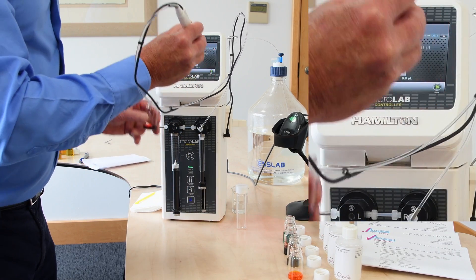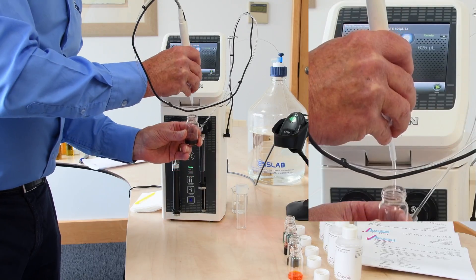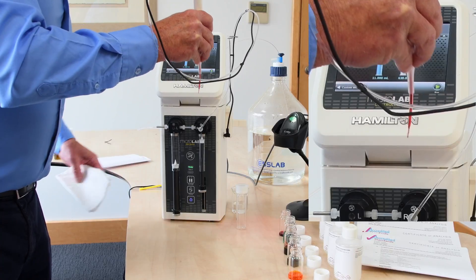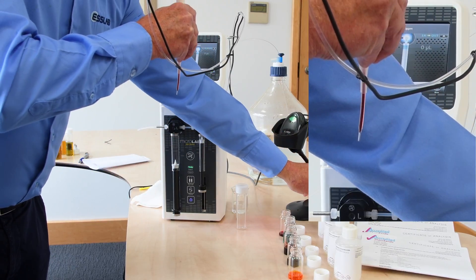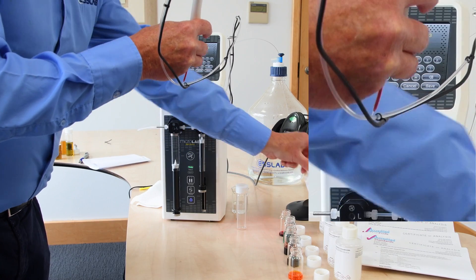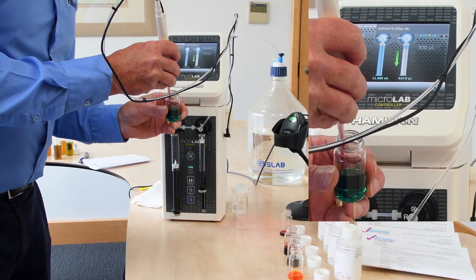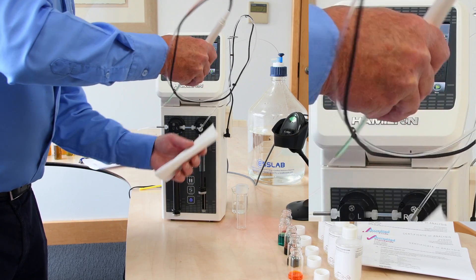I can now pick up that standard. The next step asks me to aspirate 625 µL of the standard. I pick that up — you can see 625 µL has been collected. It then asks me to aspirate an air gap and wipe the tip. It now asks me to select the manganese sample. I enter the lot ID shown in the display and scan it, giving us complete traceability on the standards we're using. It then asks us to aspirate 300 µL of that material.